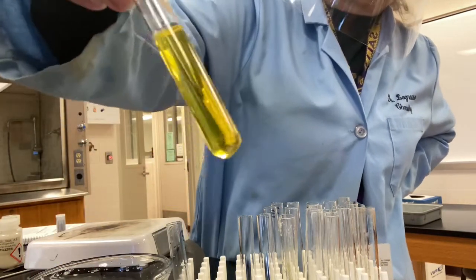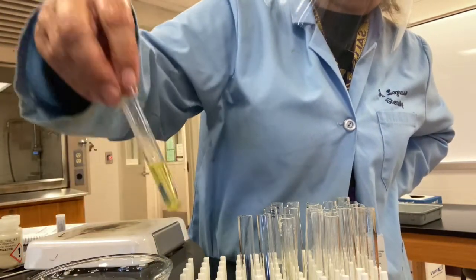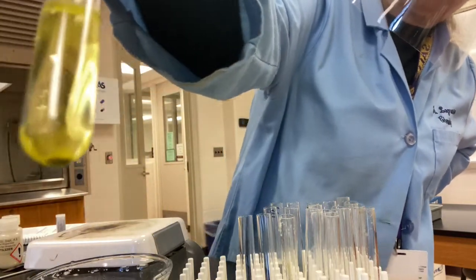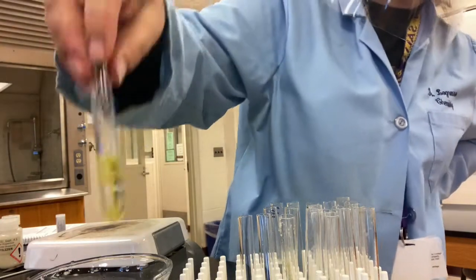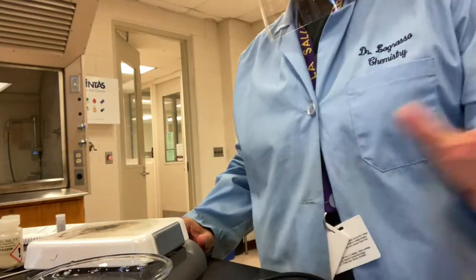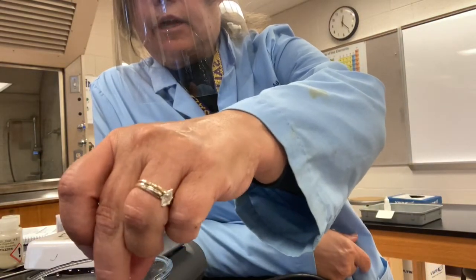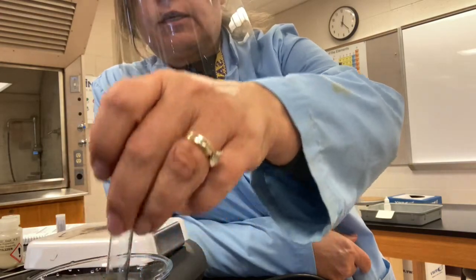I don't see anything in the detergent one yet. I'll see if maybe some form if I cool it down a bit. But I do see some in the fertilizer, definitely. If you see at the bottom, for sure I'm getting some cloudy precipitate down there with the fertilizer. So it's only the detergent right now that I can't see phosphate with. And it may be that this detergent doesn't have phosphate, and that's okay. We don't have to have a positive test, but I'm going to give it every opportunity to turn into a positive test.